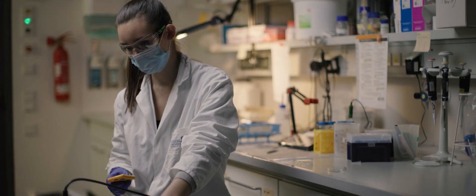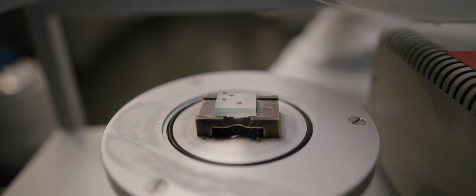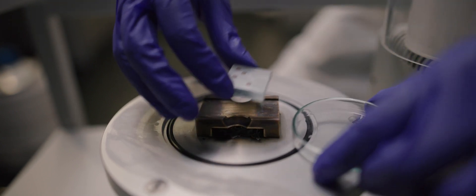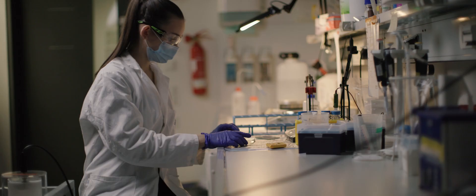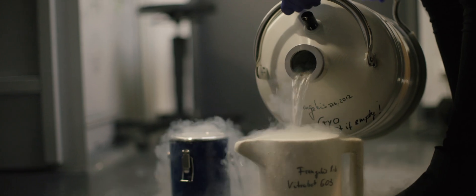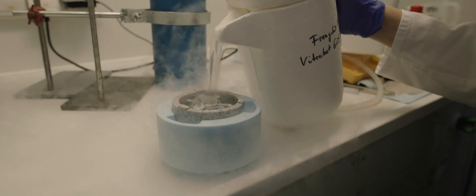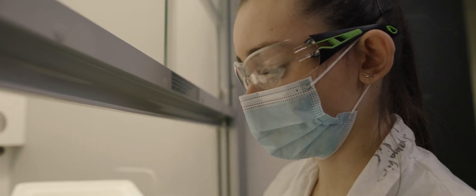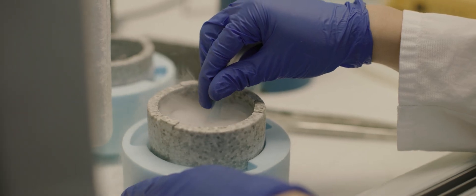In order to investigate samples in their native state in cryo-EM, we typically use plunge freezing. The sample is rapidly frozen in a way that ice crystals cannot be formed — the ice freezes so rapidly that it stays amorphous and electron transparent.